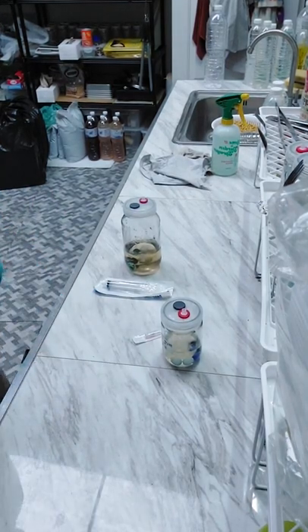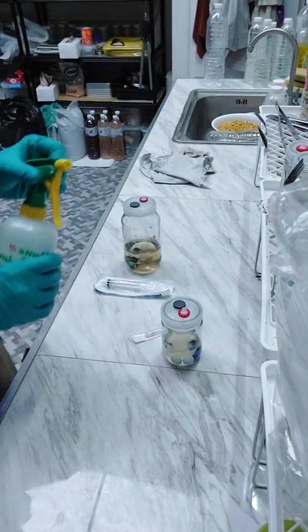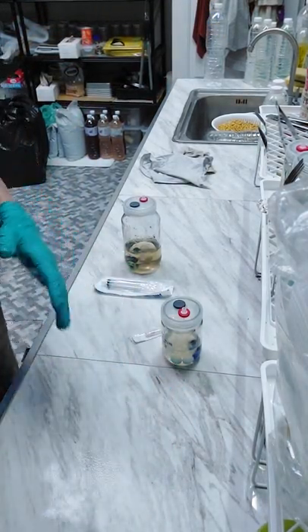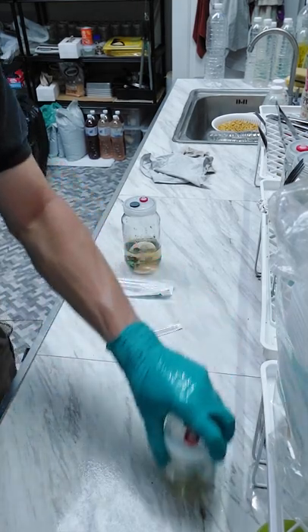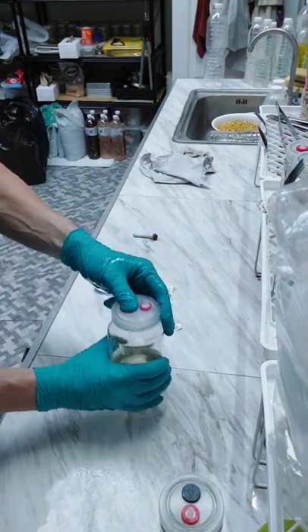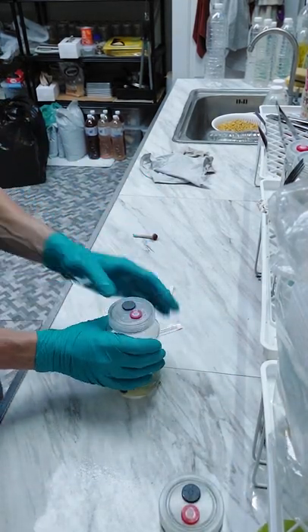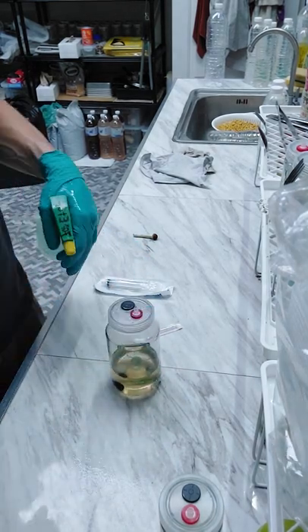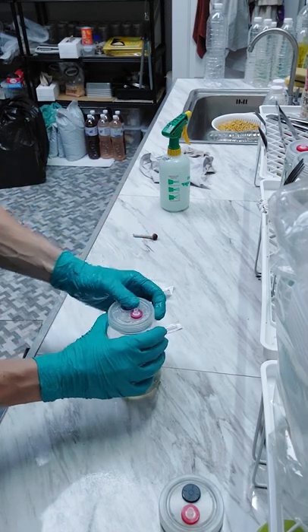Hello guys, I'm going to show you a really quick way to do a needle biopsy. First I'm going to put my gloves on, spray those with a little bit of alcohol. I am going to spray the top — I've wiped it down a little bit already — but spray that with a good dose of alcohol, 70%. And just let the alcohol sit right there on top of it.